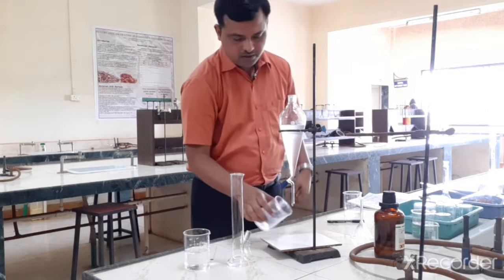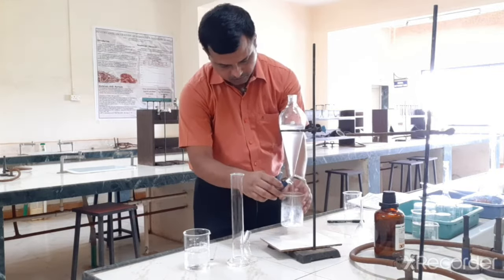Okay, so we can take out the bottom chloroform layer.